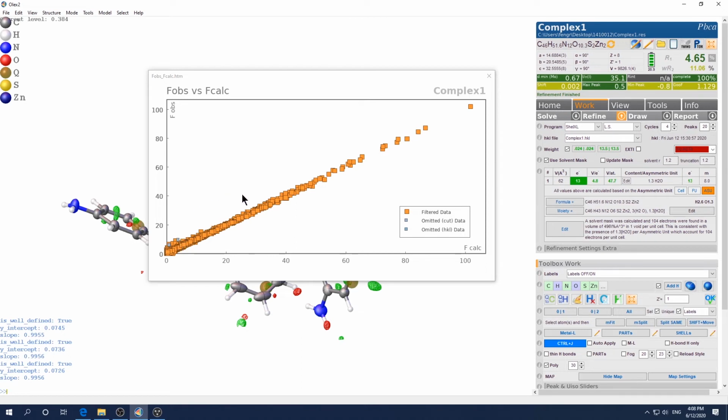If you have a bunch of outliers, or even if the outliers are not random and show an underlying pattern, then you cannot just simply remove them or ignore them. You have to explain. It might be some kind of unaccounted twinning or even the space group being wrong, etc. But for just a couple of outliers, just safely ignore them. No problem. It must be some kind of error, like the beam stop being in the way, or the detector has a mini speck of dirt or whatever. You don't need to explain at all.